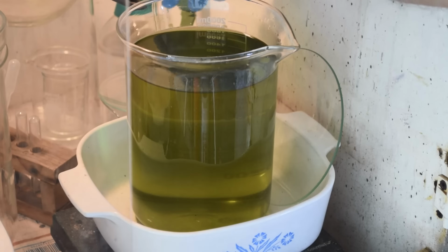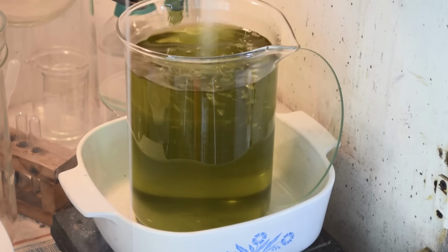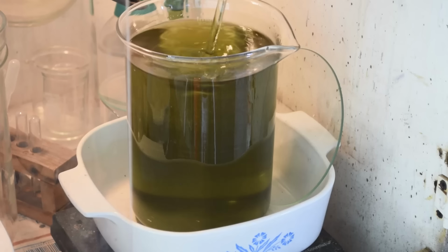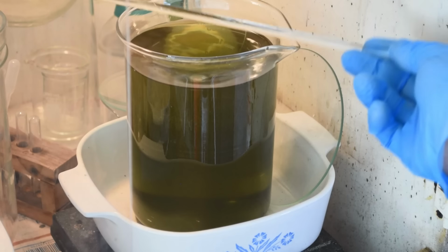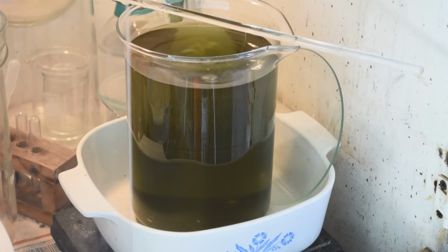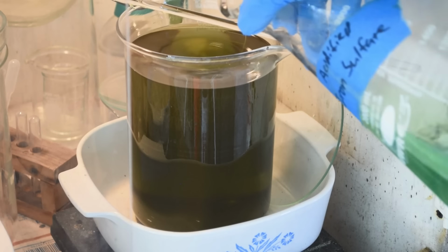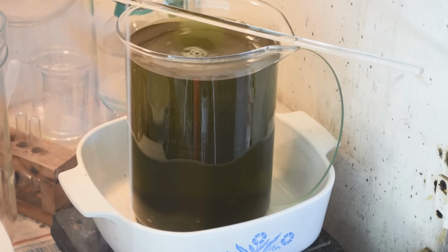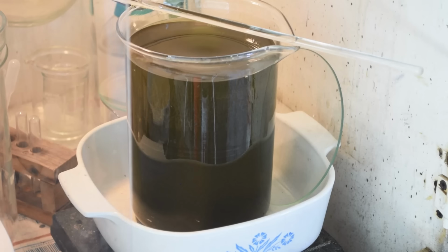Oh yeah, it's darkening up. Getting a gold drop. I can put a little bit more in. The beaker's not quite full. Just to make sure we get a complete gold drop. Oh yeah. There we go. Excellent. All right, we'll just let that sit and settle out, and we'll see what we get.